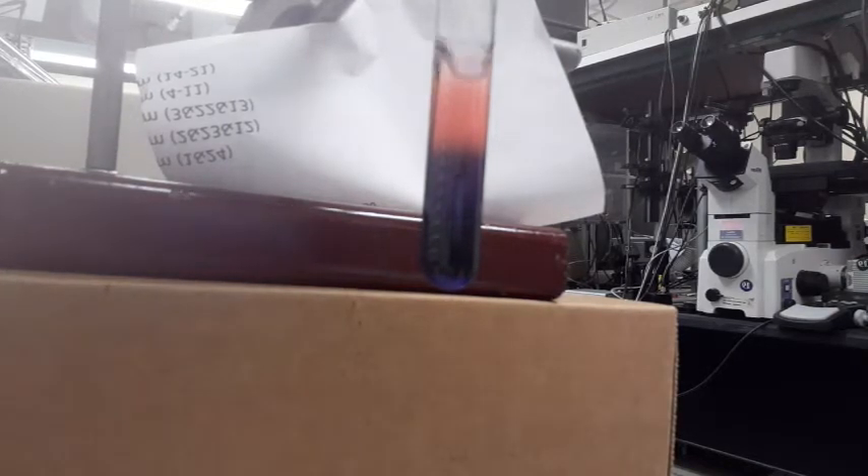Now the cobalt-2-tetrachloride will be shifted back to the pink by the addition of water into the system. As you see, I'm just adding pure water, and it's being converted to the pink. I'll stir and mix this — and now the equilibrium has shifted back to the pink.